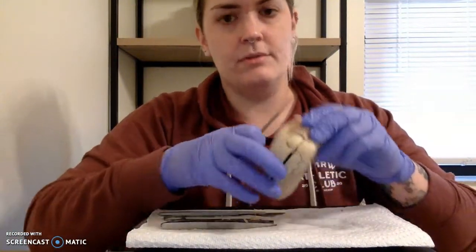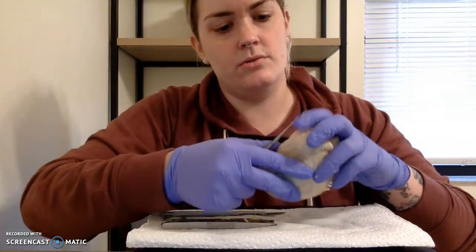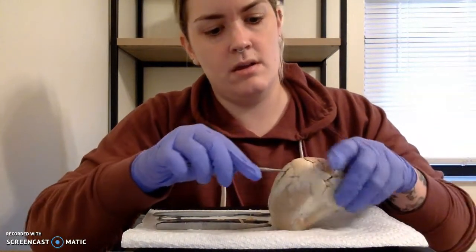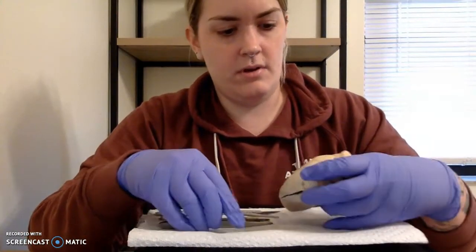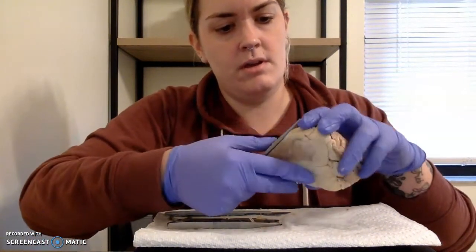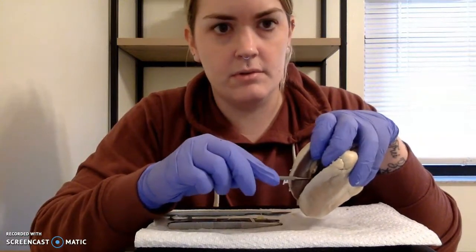The first thing I want to look at on this heart is our left and right atriums, those top portions. You can see that here. You can also see it when the heart is dissected. They're going to be the top chamber here, and then again on our other side, top chamber here. And then you've got your left and right ventricles, those bottom chambers of the heart. You can see from the right dissection a decent view of the ventricle.